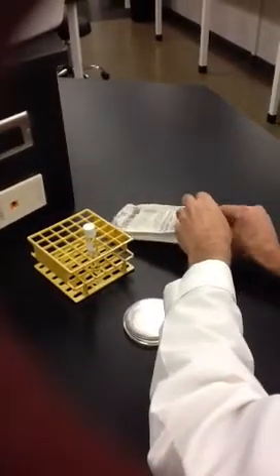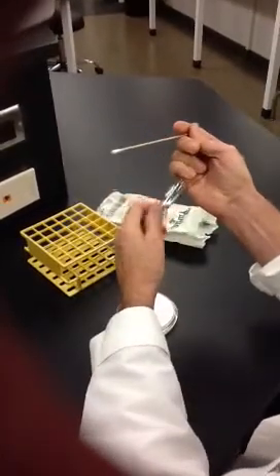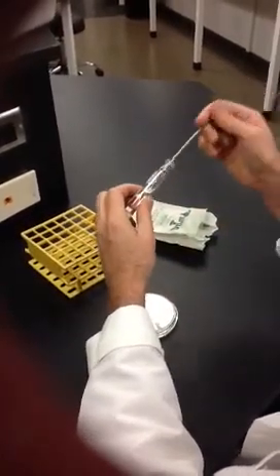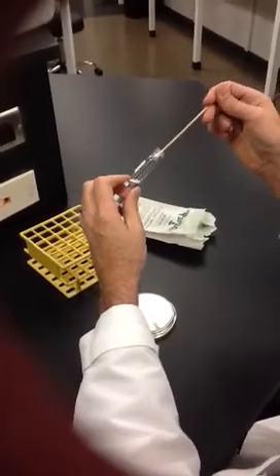First, you take a sterile swab, soak it with the culture, and then squeeze out any excess fluid.